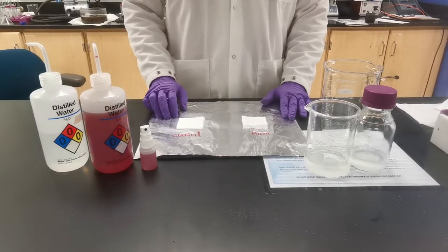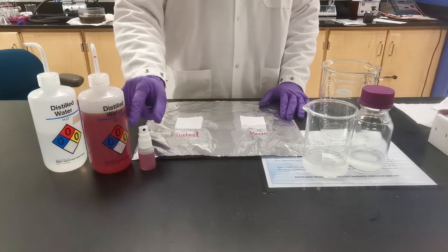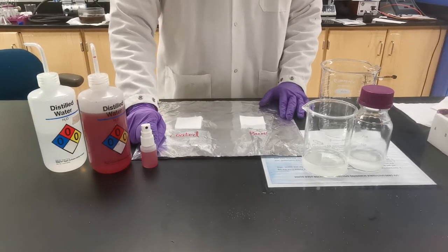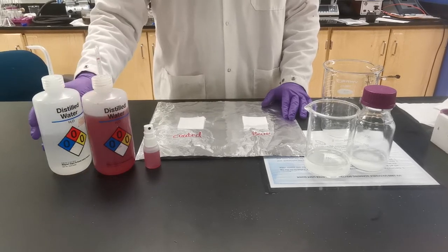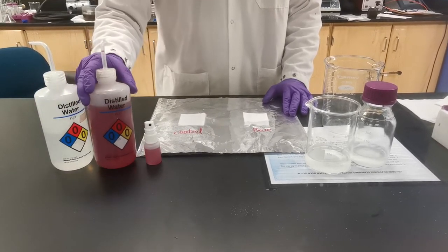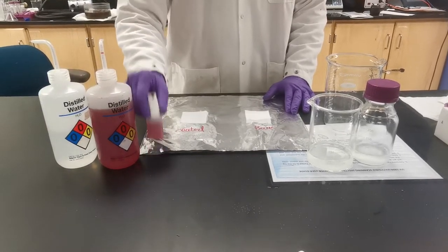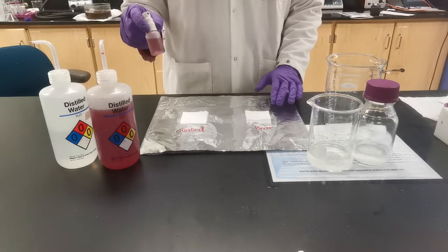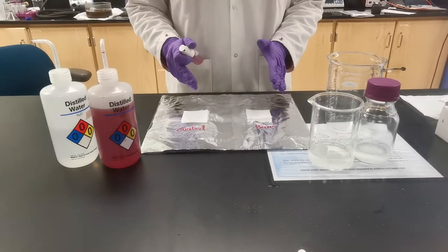After our coated fiber was dried, we prepared three different bottles: one spray bottle with red color water, and another two wash bottles — one with colored water and one with pure water. We will use the spray bottle to simulate aerosol on the fibers.